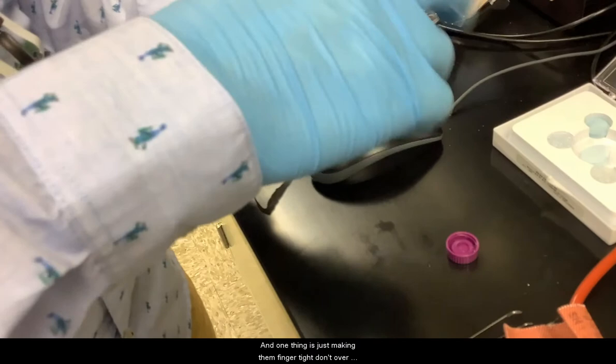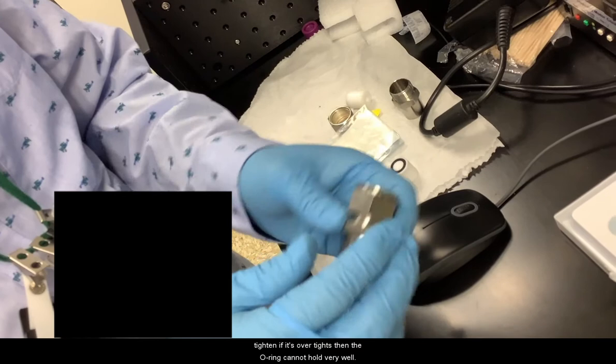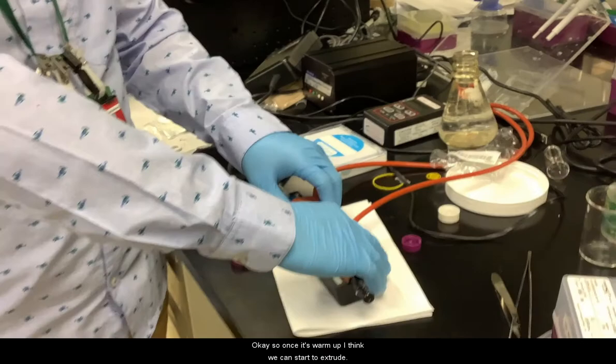Then you can screw them. One thing is just make them finger tight. Don't over-tighten. If it's over tight, then the O-ring cannot hold very well.